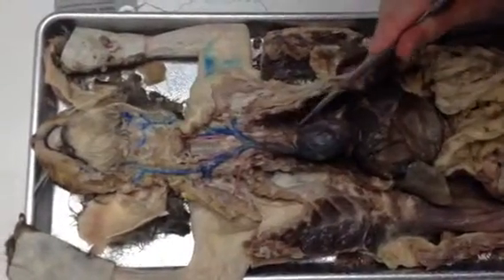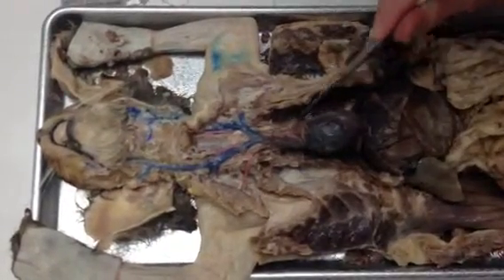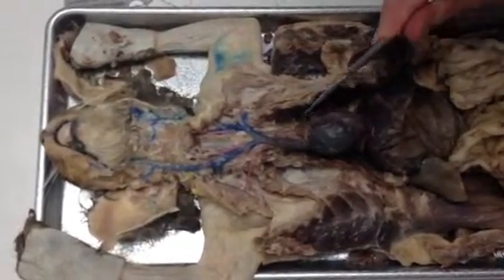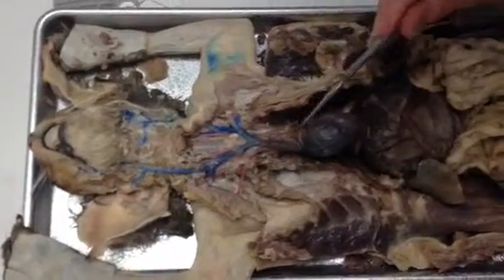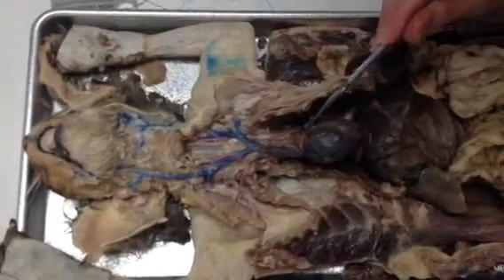All right. The aorta is not quite exposed very well in this cat. I think it's right here. There it is. You see the arch? It's hard. The arch is a little bit hard to see, but you can kind of see it right here. Here it comes around like this. This is the aortic arch, okay?